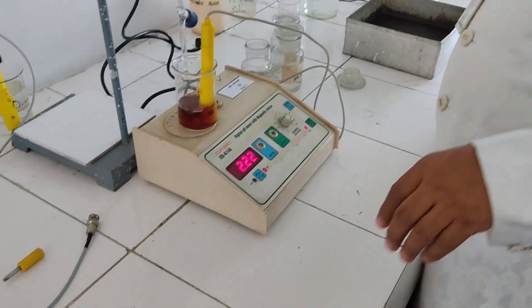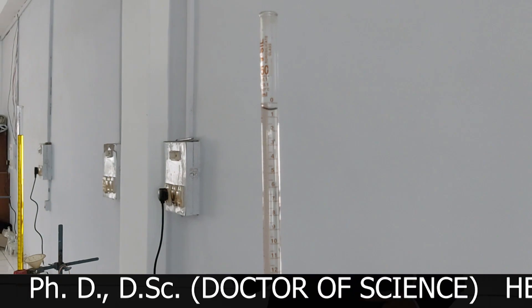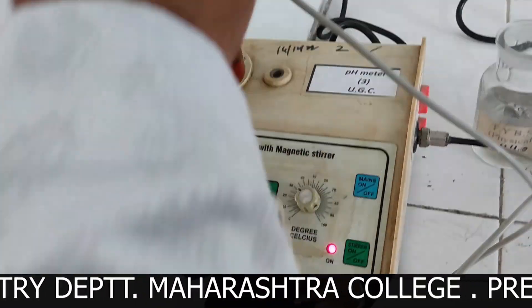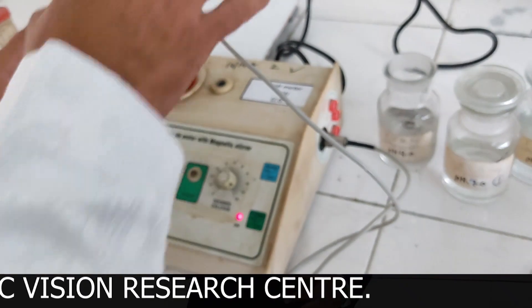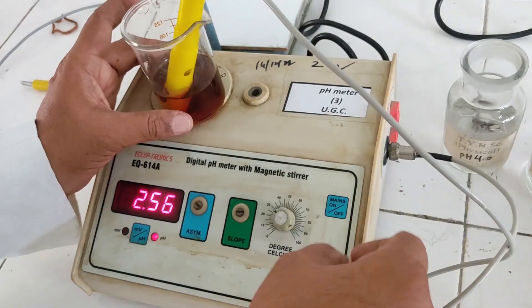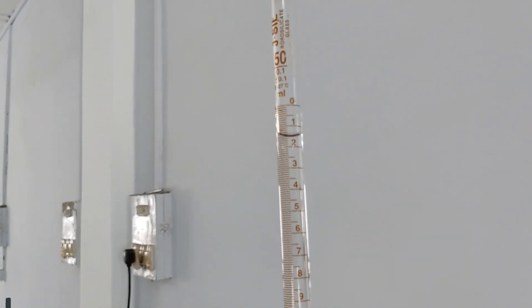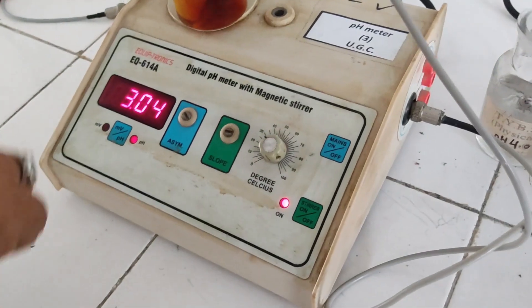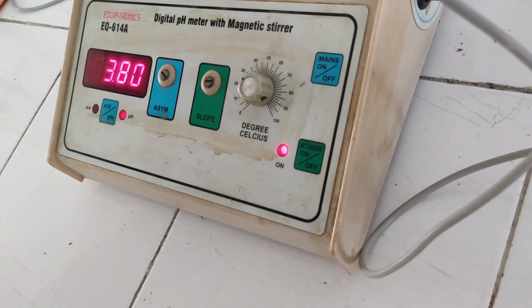Now I am going to add 0.5 ml. See carefully — 0.5 ml at a time. You can see the pH value is increasing. I am adding another 0.5 ml. You can see pH is increasing. If something goes wrong with the stirrer, put it off, bring it to the center, and put it on — the solution has to be stirred. Now I will be adding 0.5 ml at a time, adding up to 25 centimeter cube total.